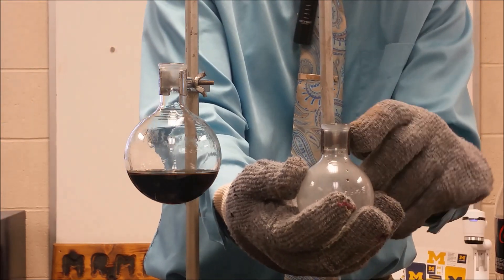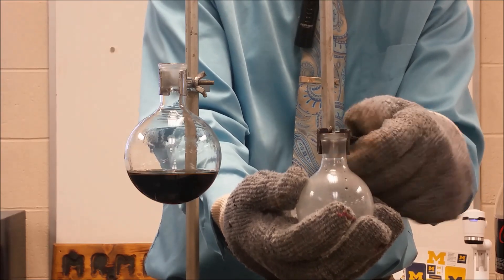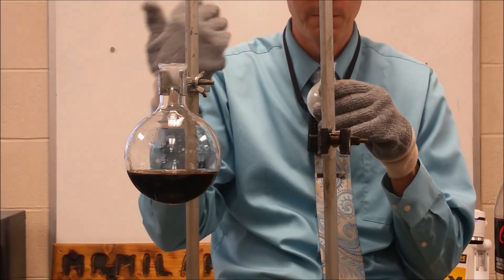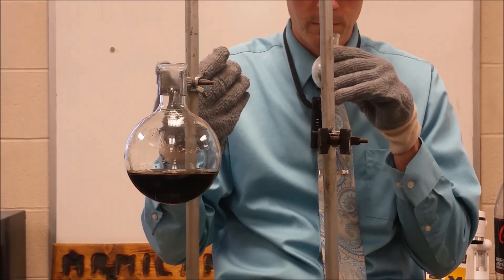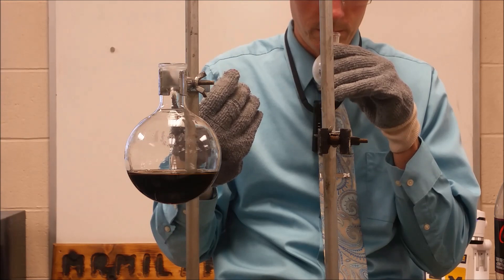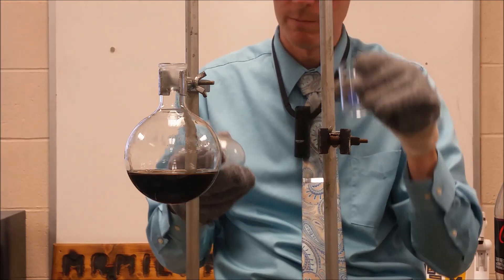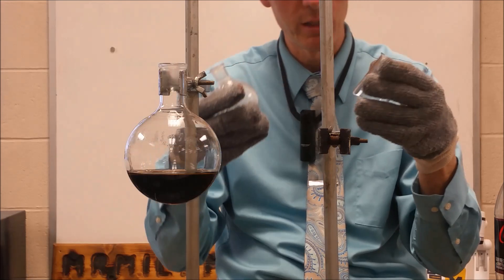We'll stick that on the rubber tubing so that nothing bad happens. And now we can go ahead and take this and this should be nice and cool. And we can check to see if it smells like cherry. Which it does.